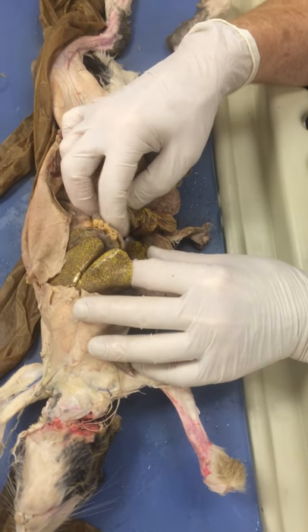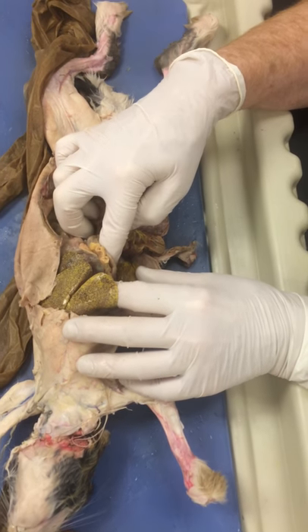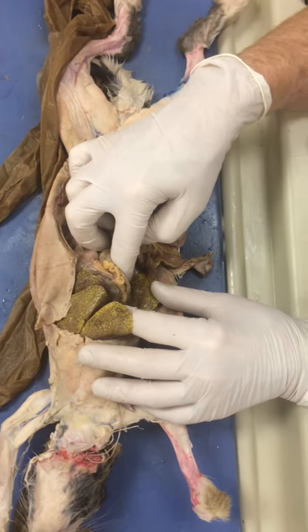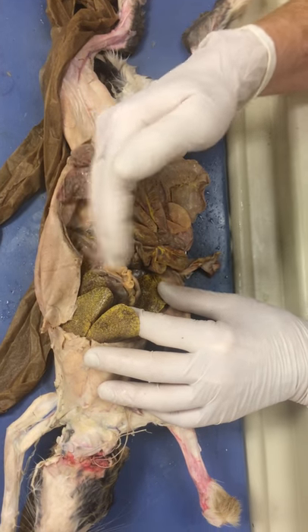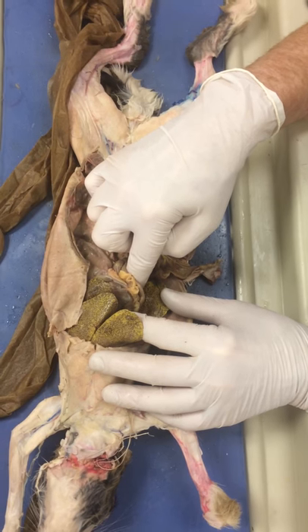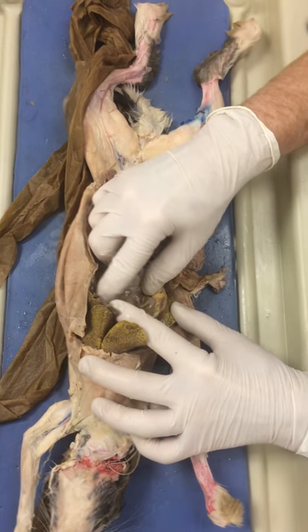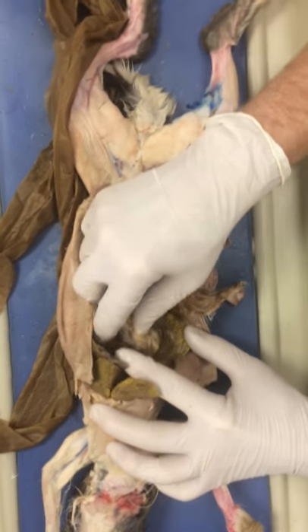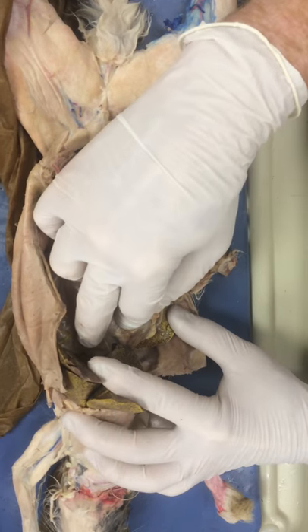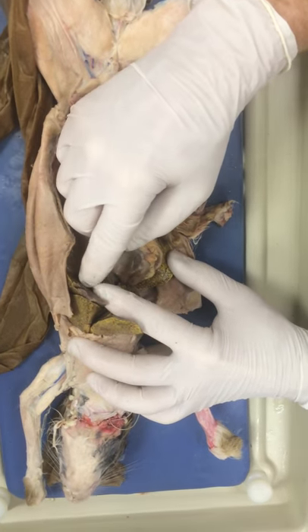You'll notice a bit of a lobe here fused with it that's more medial on the bottom body — that's your caudate, as is that one there. That piece there and that piece there are caudate, and that just leaves us the quadrate.